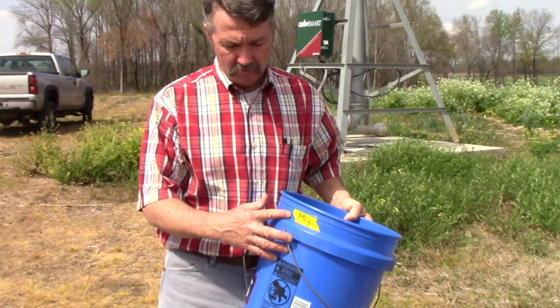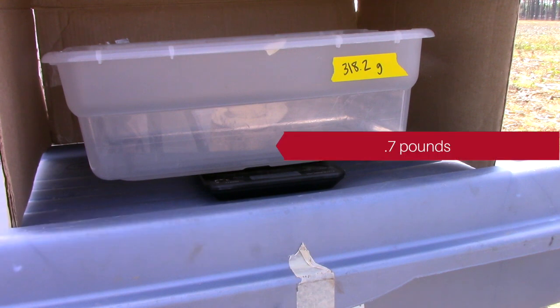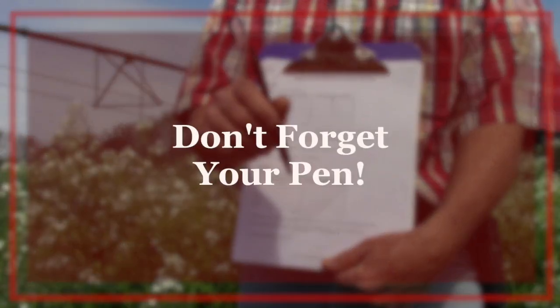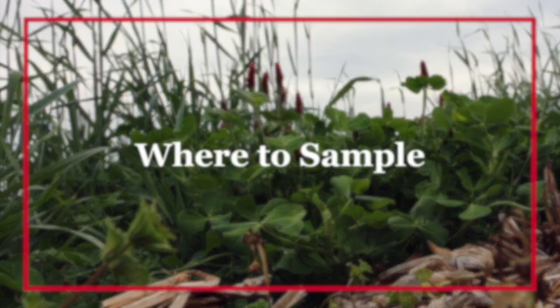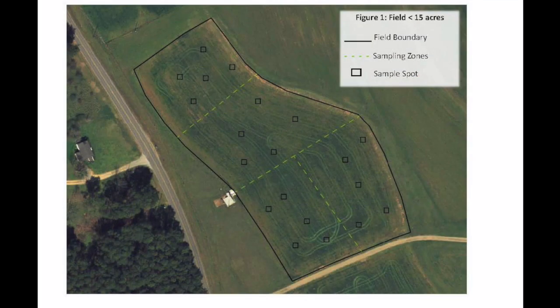Weigh the container in which you will be placing the cover crop sample. You will also need a scale that weighs in grams or pounds. Finally, make sure you have a prepared data sheet, like the one found in Appendix A of the Cover Crop Biomass Sampling Circular. Once you have all of your material together and have determined where to take your subsamples, it's time to go take the samples.